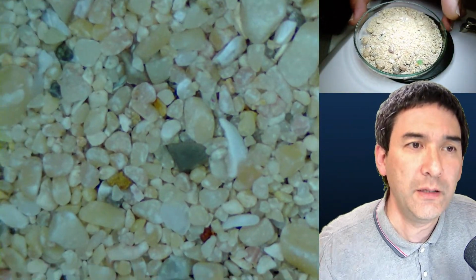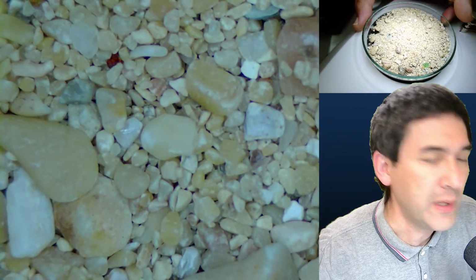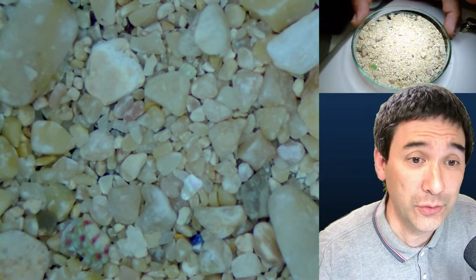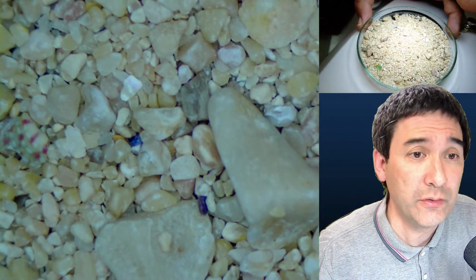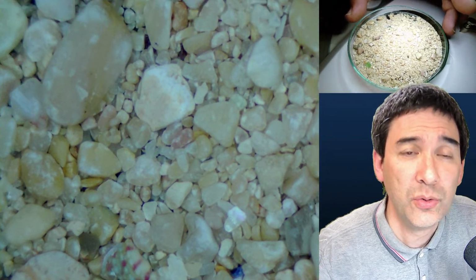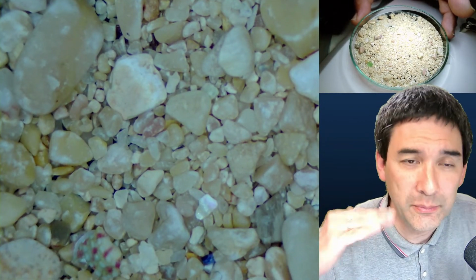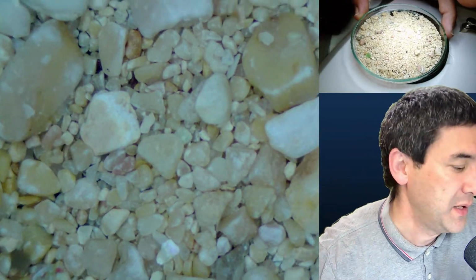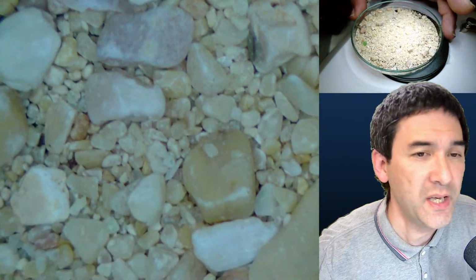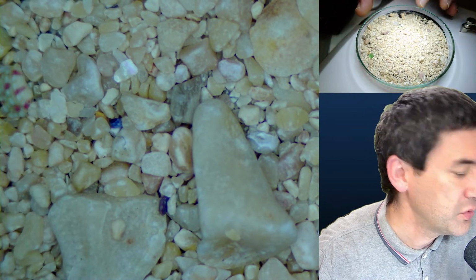Just for your info, a little bit of why I was not successful with a little experiment here. I actually tried to extract some microplastics from the sand, and I couldn't find a lot. Not because there are generally no microplastics present, but maybe due to the wave action, the denser sand has settled on the bottom and the lighter microplastic has been swept away. So I think there has already been a separation process on the shore. That's my hypothesis, because I actually did find quite a bit of other types of plastic. Something blue over here as well, I don't know what that is.